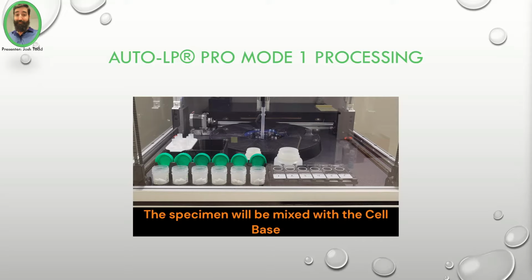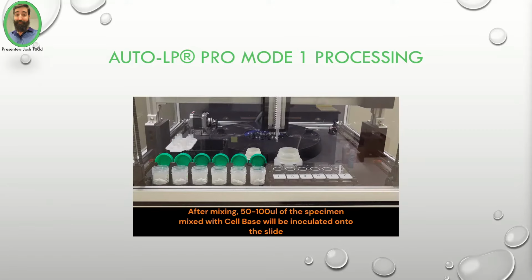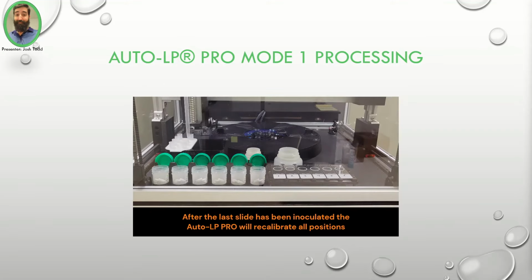After the specimen has been mixed with the cell base, the AutoLP Pro will apply it to the appropriate slide. After the last position has been inoculated, the AutoLP Pro will recalibrate all positions.